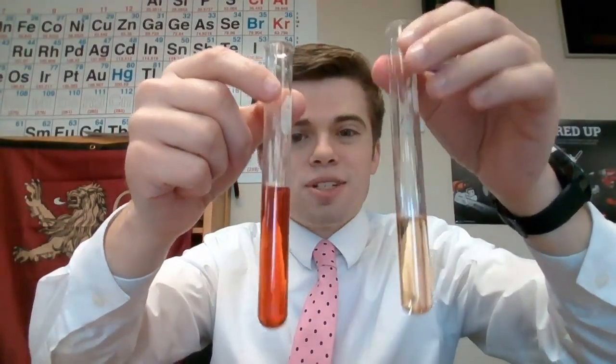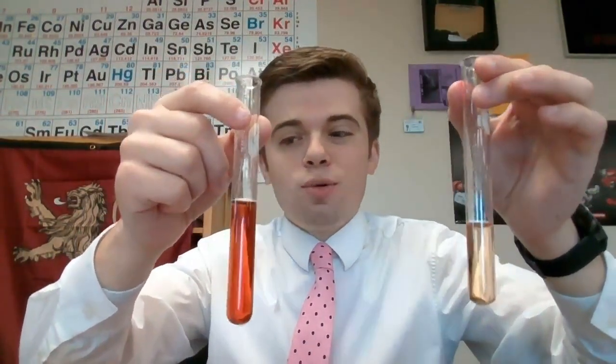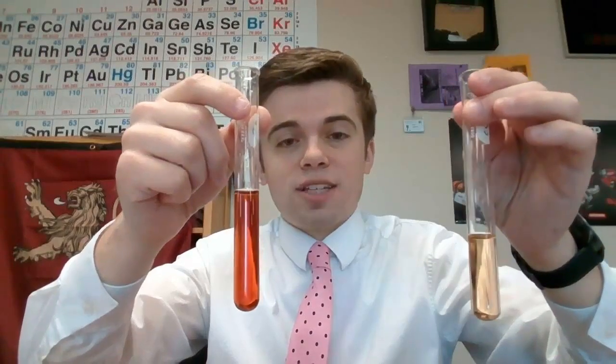And we're going to compare this to our control solution. I want you to tell me once again what happened. What did we see change here? And tell me what direction did the equilibrium shift when we added in this KSCN.